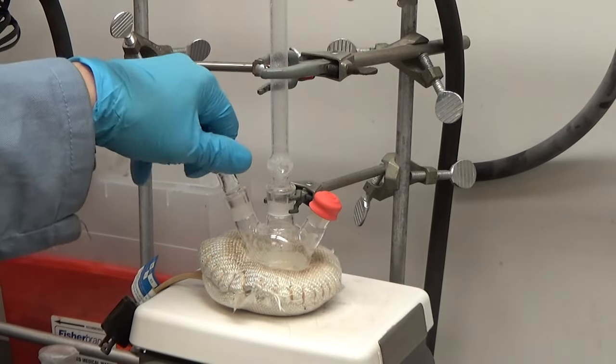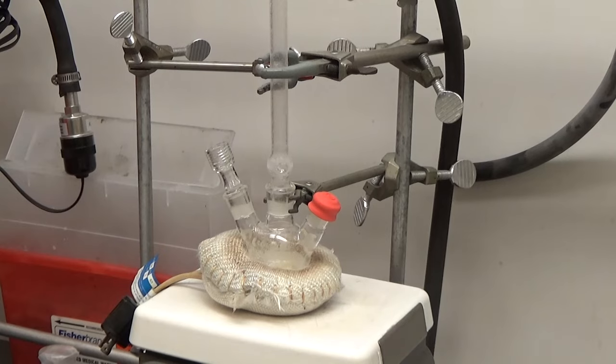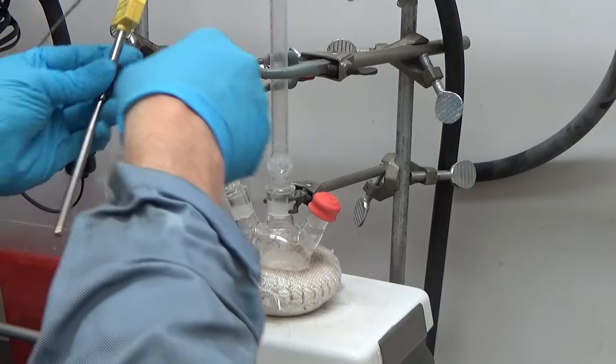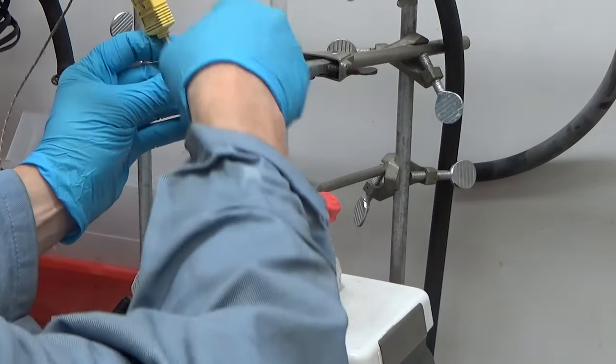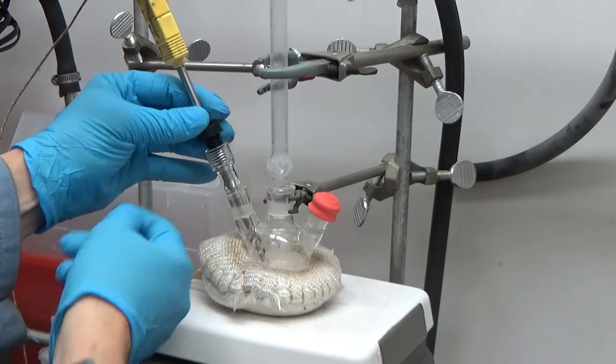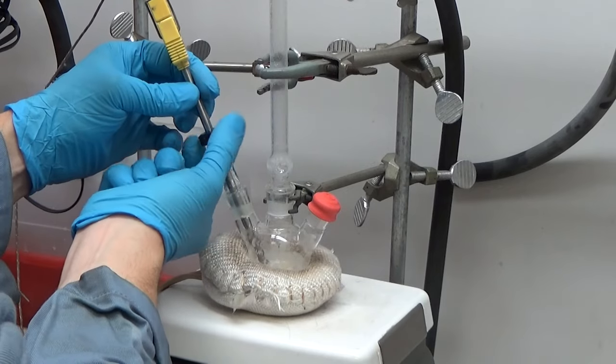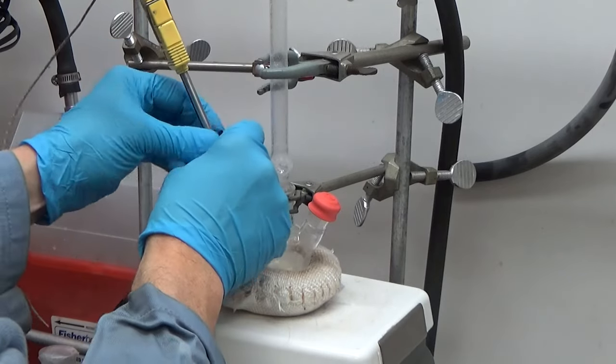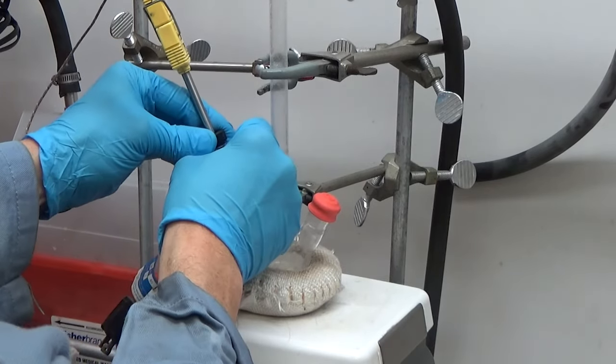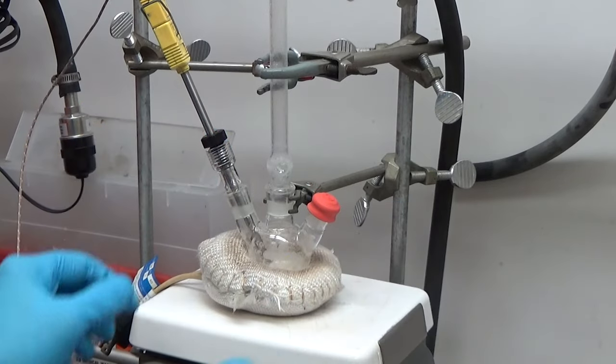Here's our temperature adapter. And for the temperature probe, you use a little adapter called a bushing. And the bushing attaches to the adapter with a little O-ring. You should use VITON. VITON is chemically resistant. And if you just tie it in finger tight, that should be vacuum sealable.